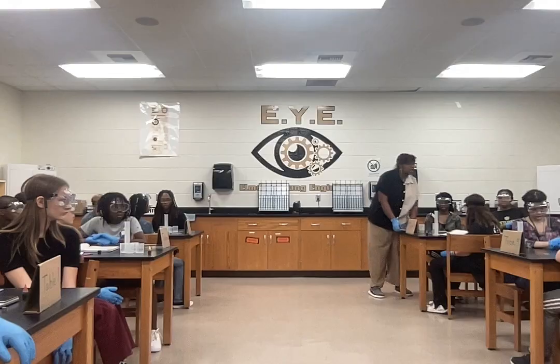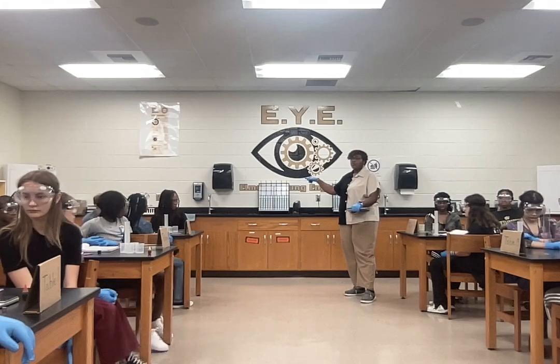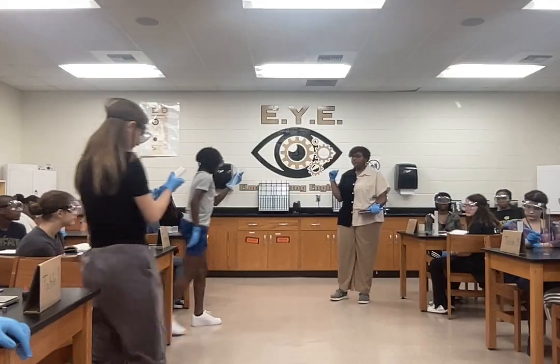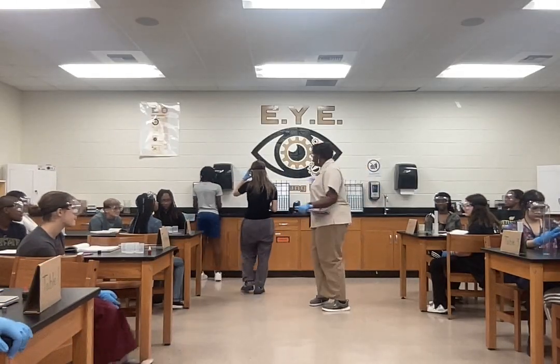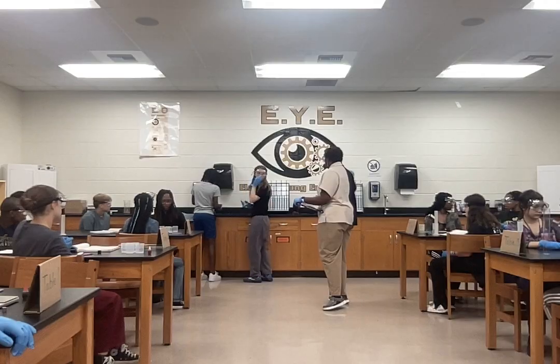Okay? So, let me have table 1 and table 2 come back here and get 25 milliliters of water. Just one person from your table bring the graduated cylinder. Okay. Go ahead and get 25 milliliters. And when they get done, then table 3 and table 4 will go ahead and do the same thing. Use this sink right here.